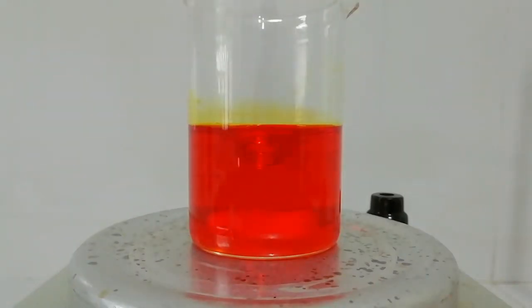Now we need to add 6.3 milliliters of ethanol. We cannot add this ethanol all at once because it will produce heat and evaporate our ethanol, so we need to add it dropwise. You can see a color change when I add the ethanol.